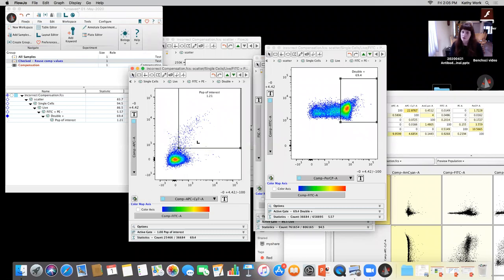And when I did a deep analysis for this, what I actually found when I took a close look and did a very, very strict gating exactly how they did in their experiment, the population of interest actually almost doubled. It went from roughly 0.8, 0.9 with a fine-tuned analysis of how they originally did it to about 1.7, 1.8. When you're looking at rare populations, again, I'm going to sound like a parrot here, but you have to be very careful of all the decisions that you make, because if you just decide to go ahead and reuse old comp and say, it's fine, it doesn't matter, you can wind up very easily gating incorrectly and having populations that do not make sense.